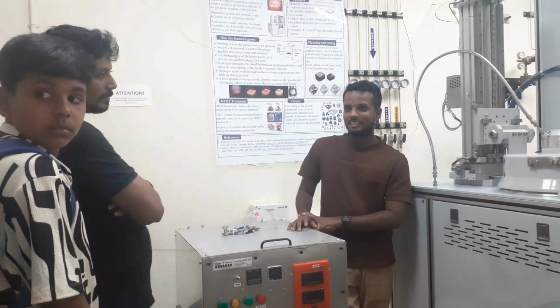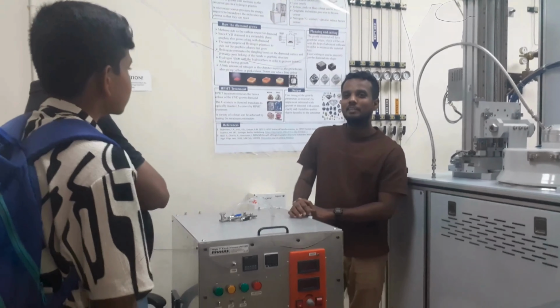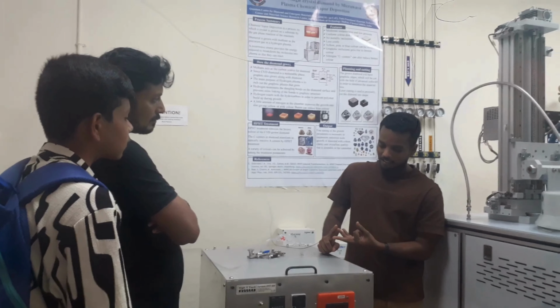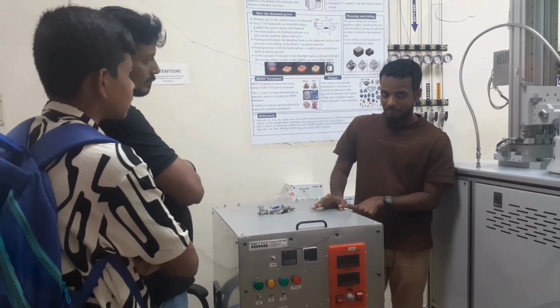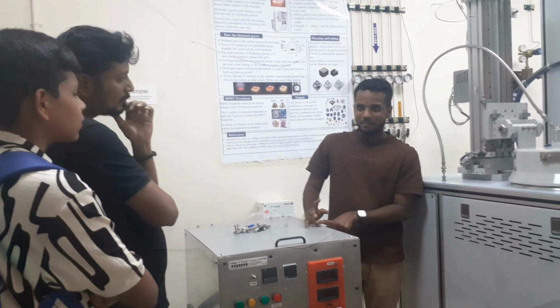How do you confirm the diamond has formed? By the properties, like reflectivity. We have more than 15 analytical instruments in the research park. We have Raman with 6 lasers, PL, SEM with cathodoluminescence, IR, fluorescence, ellipsometer, AFM, SPM, nano indentation, XRD, thin film XRD, orientation XRD, XPS, then IV probe, Hall, and EPR.